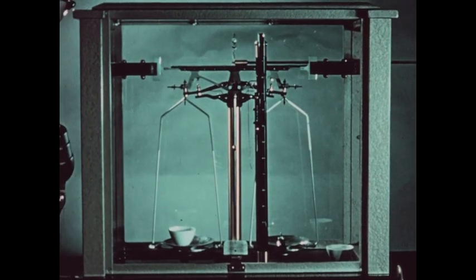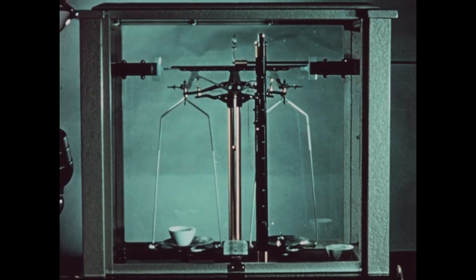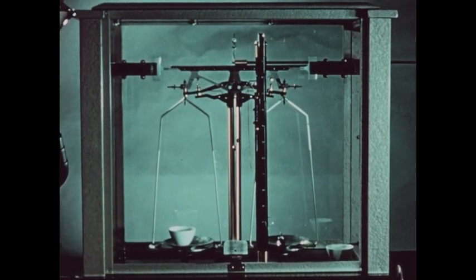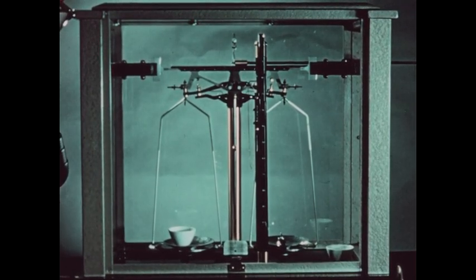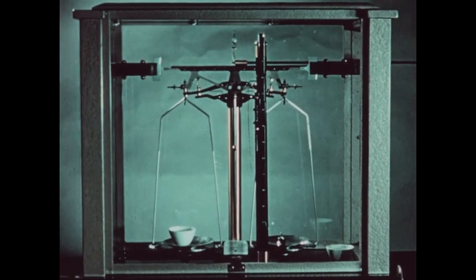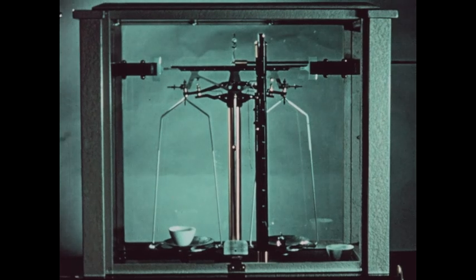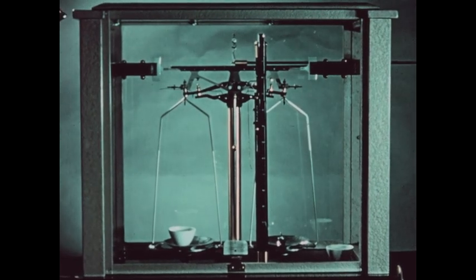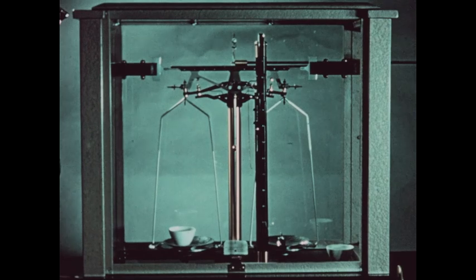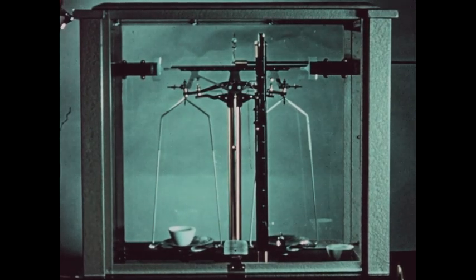In this experiment, we're going to first carefully weigh out a sample of copper, then combine it with sulfur, and find the weight of the product. To do this, we need to first determine carefully the weight of two small porcelain crucibles, because we're going to carry out this experiment in duplicate — that is, we're going to run two experiments all the way through.